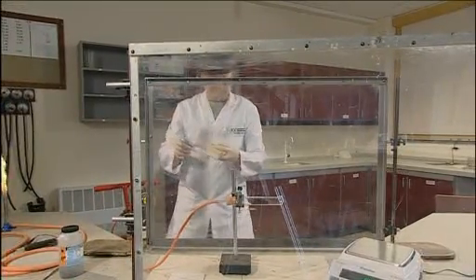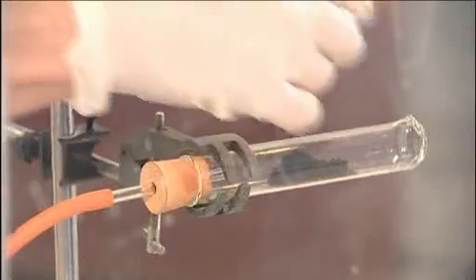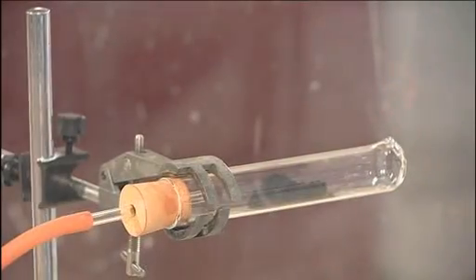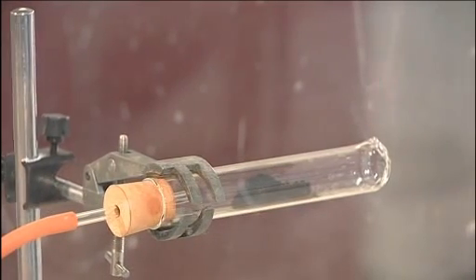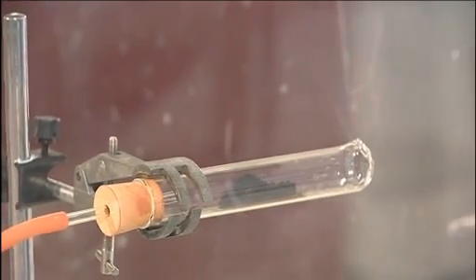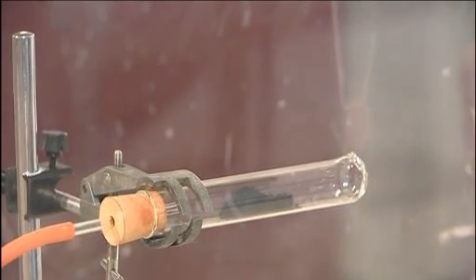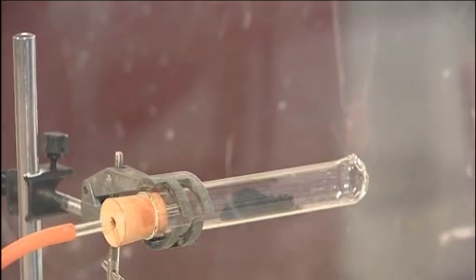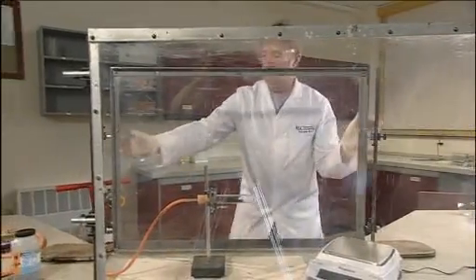Once something like a minute has passed, we now can light the hydrogen and adjust the flame until it's about two centimeters or so high. At this point, there's no more explosion risk so we can dispense with the safety screens.